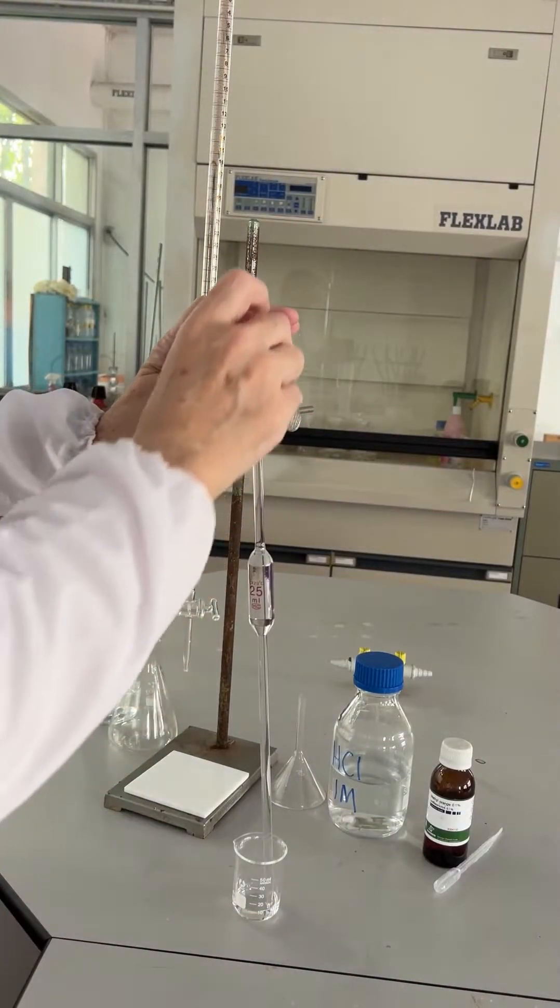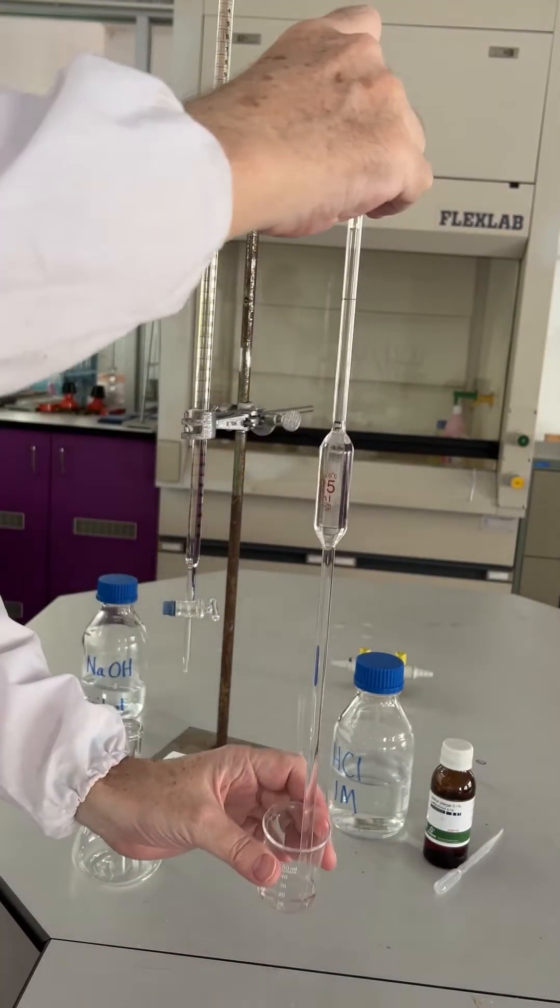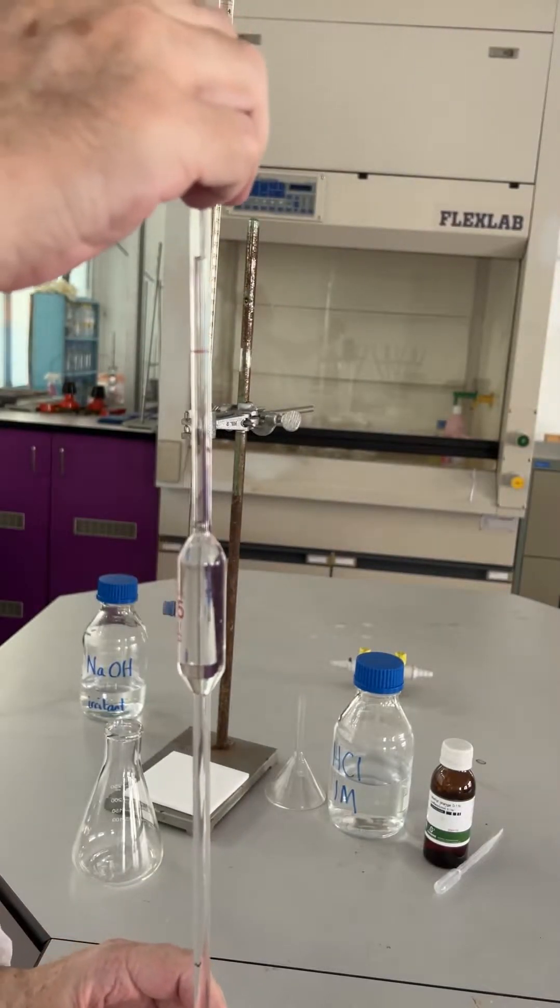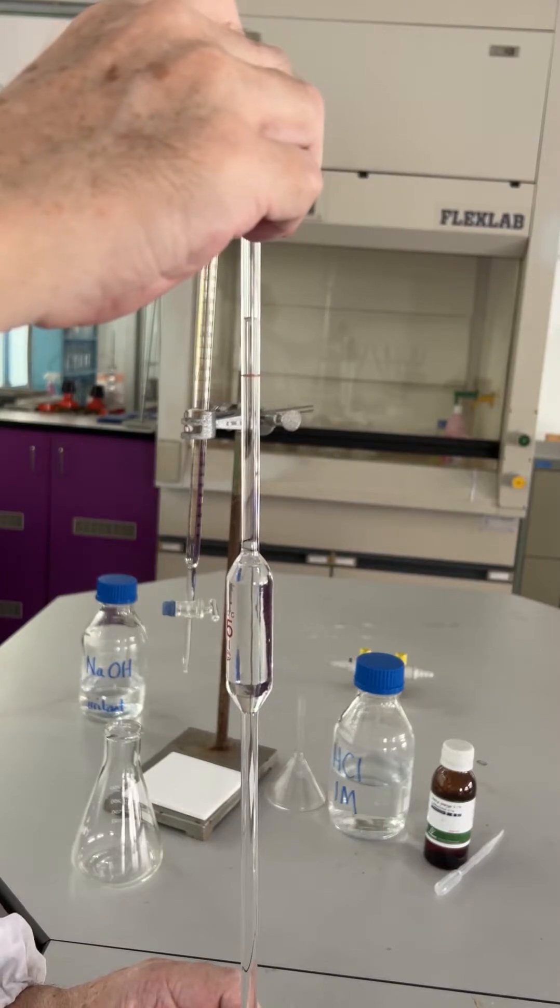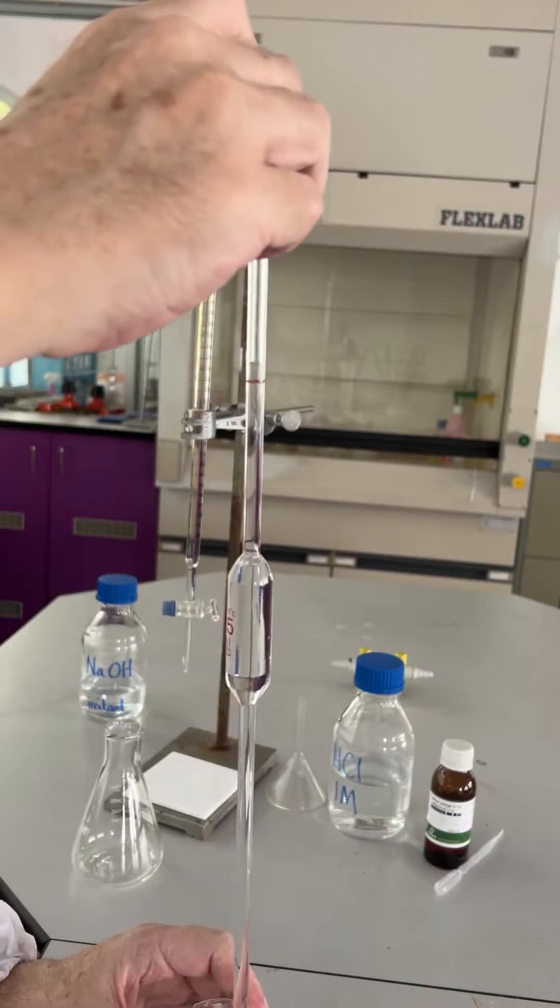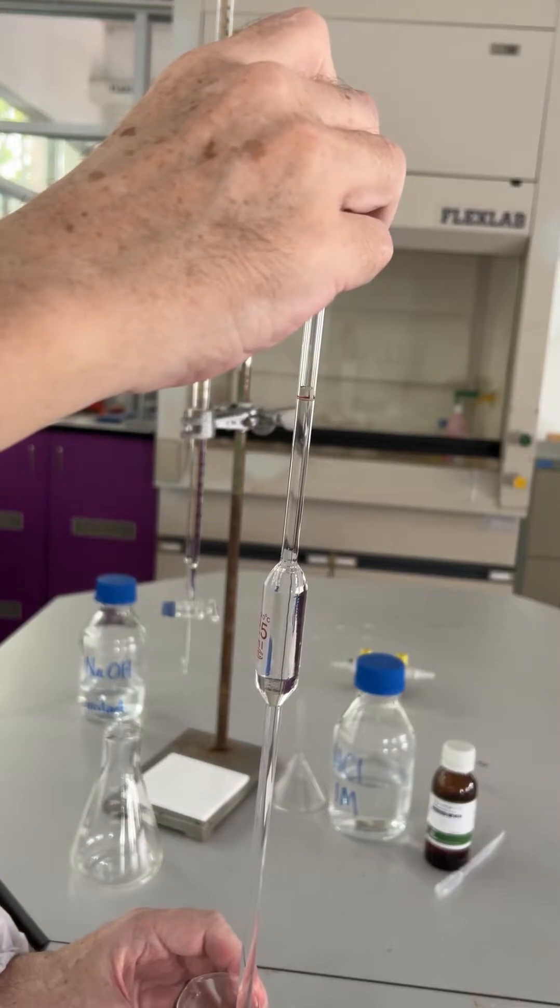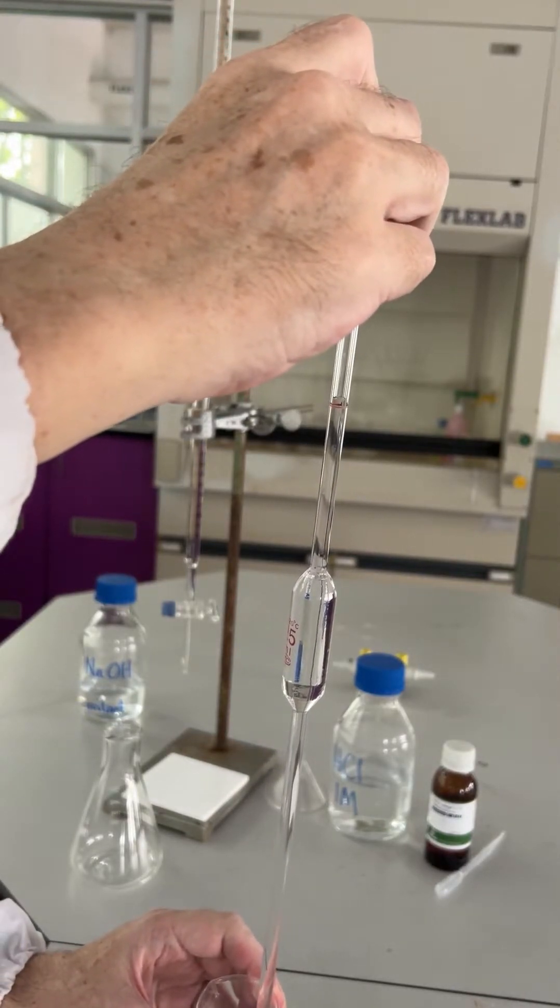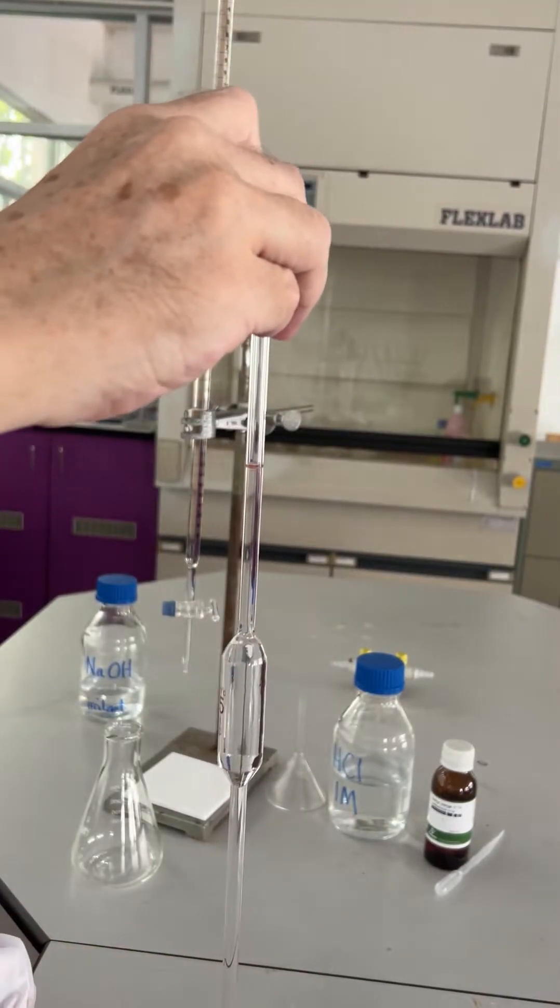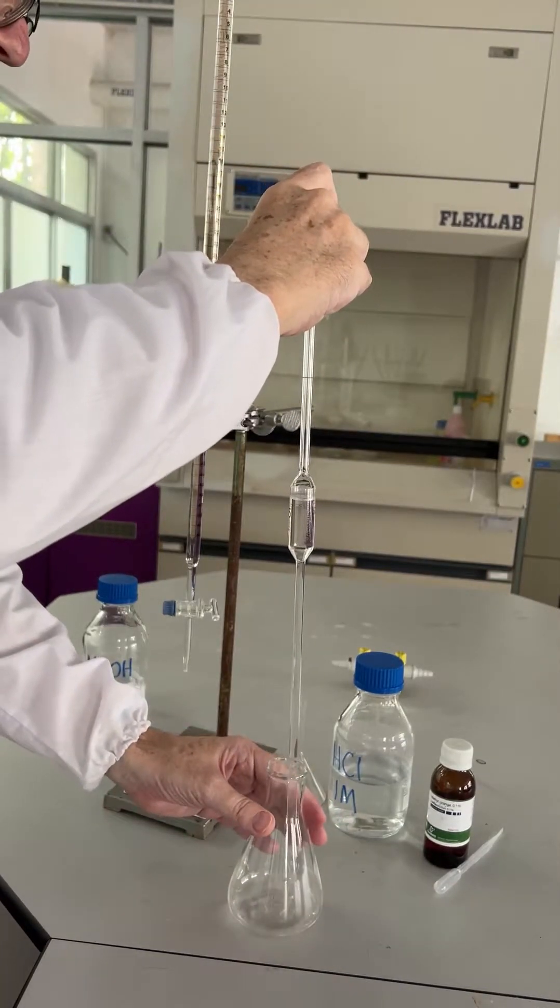So you can see you can easily switch fingers and it's far more sensitive to lower that down to the line using a finger. So 25 cubic centimeters.